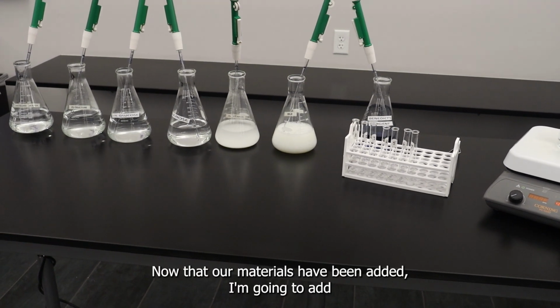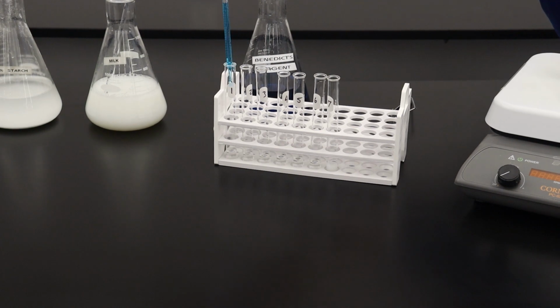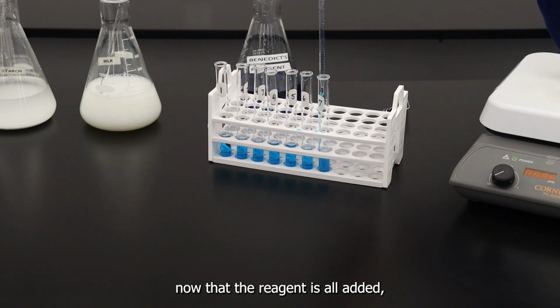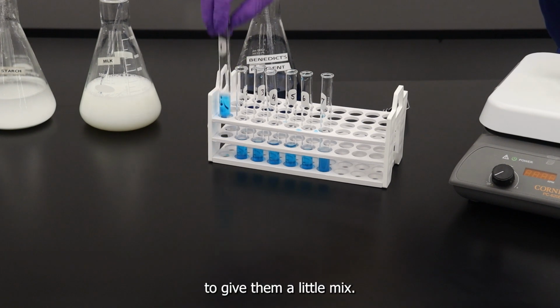Now that our materials have been added, I'm going to add 3 milliliters of Benedict's reagent to each test tube. Now that the reagent is all added, I'm going to give them each a gentle stir to give them a little mix.